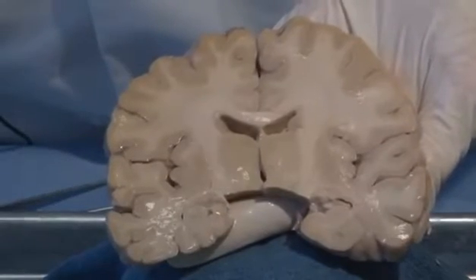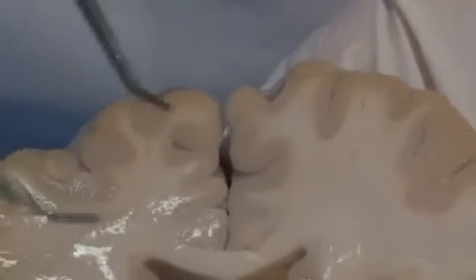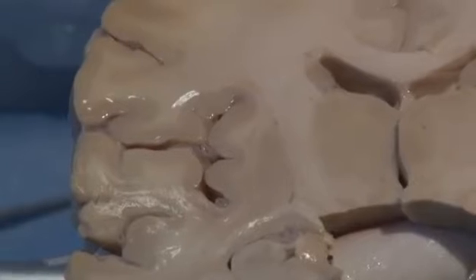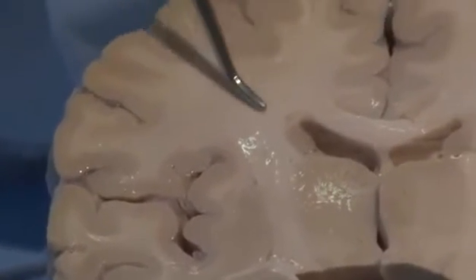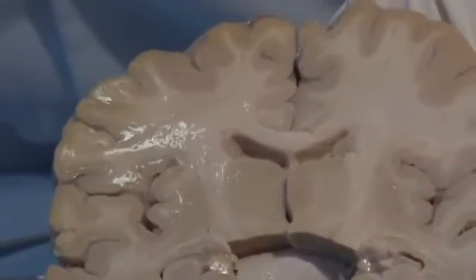We'll deal with these in more detail, but right now you can see that those gyri that we were looking at and the sulci, the dips in between, can be easily distinguished. And the gyri are covered with a nice layer, beige in color, and that is your gray matter, as we say, of the cerebral cortex. Maybe we should have called it beige matter. And beneath it is a lighter area, which we call the white matter. In general, gray matter consists of cell bodies, both neurons and glia, and white matter are axons.